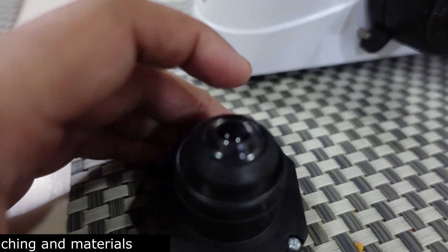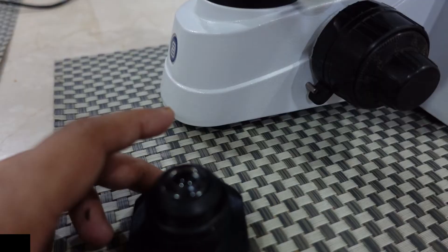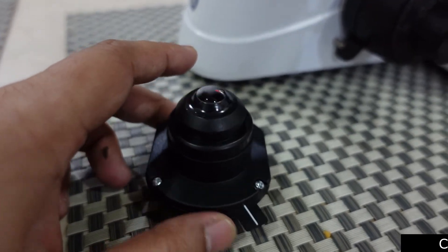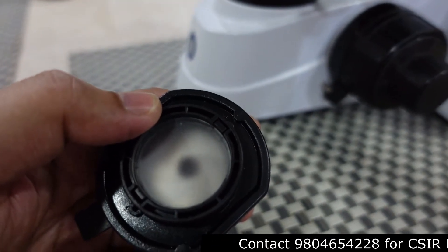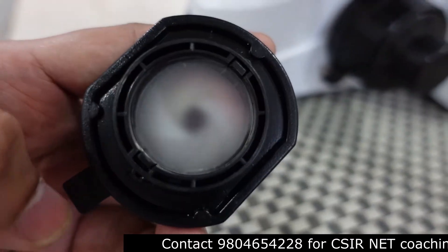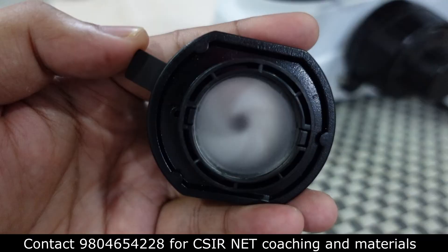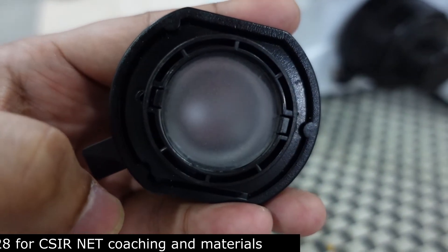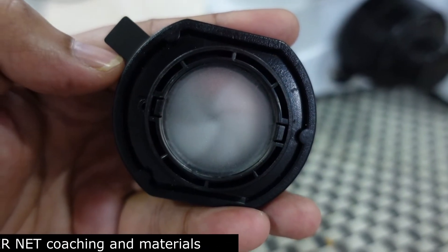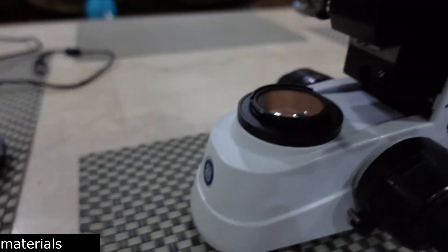The diaphragm is located beneath the condenser. Its job is to control the amount of light passing through the specimen. When fully open, a lot of light passes through; when fully closed, only a little light passes through. So the diaphragm is placed beneath the condenser — that's how the organization is done.